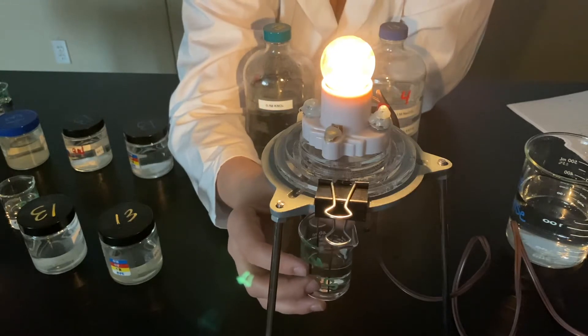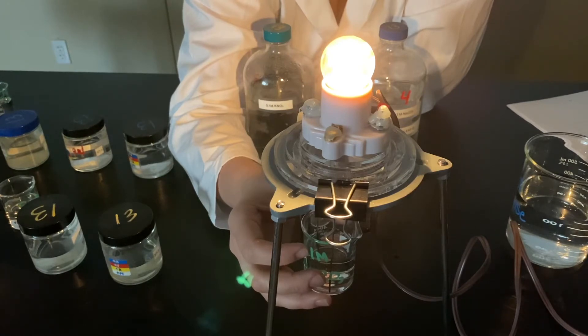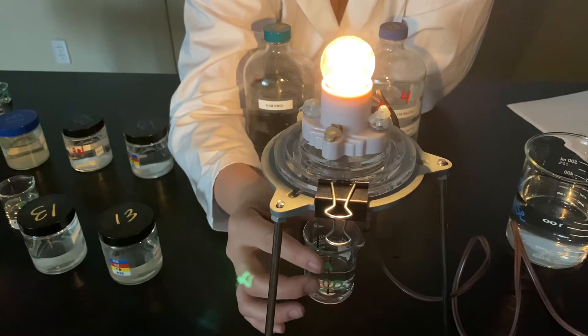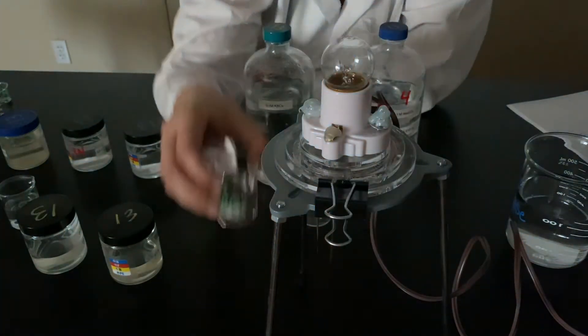So what's interesting about this is that means no precipitate is formed. I still have all ions in this solution. So it's a bunch of aqueous things floating around, a bunch of ions floating around, which makes it light up.